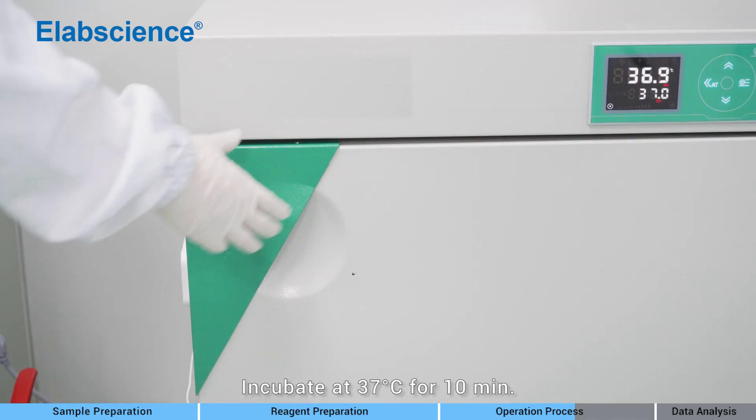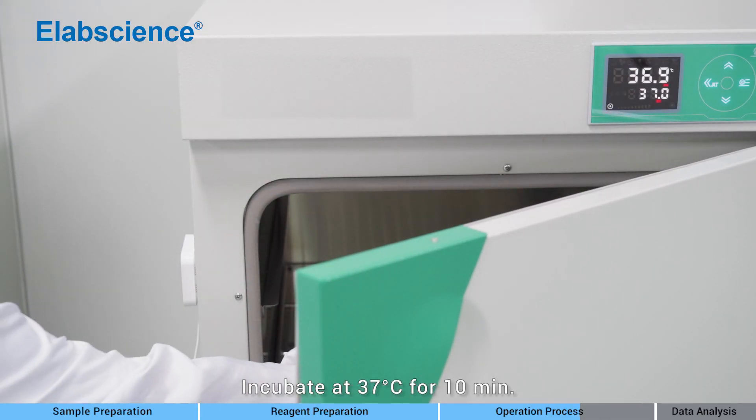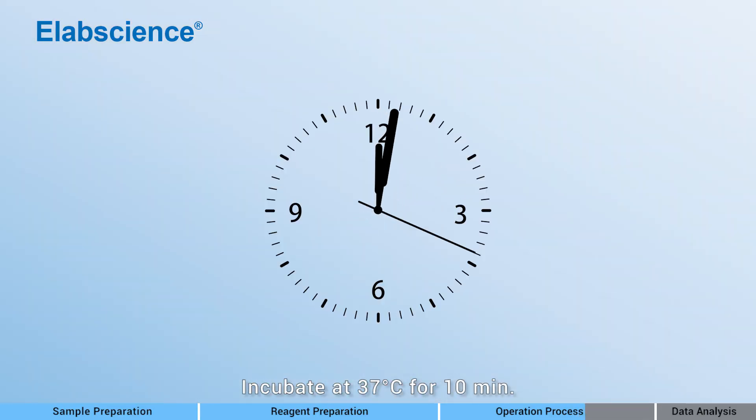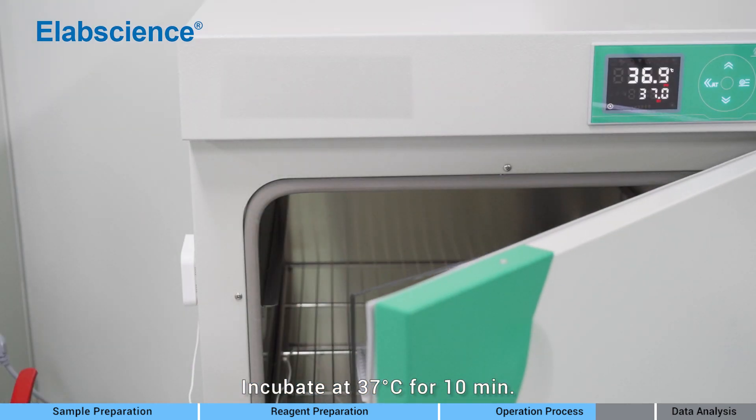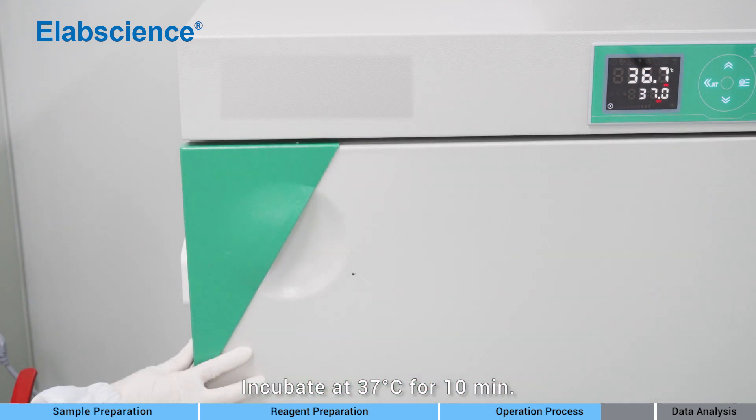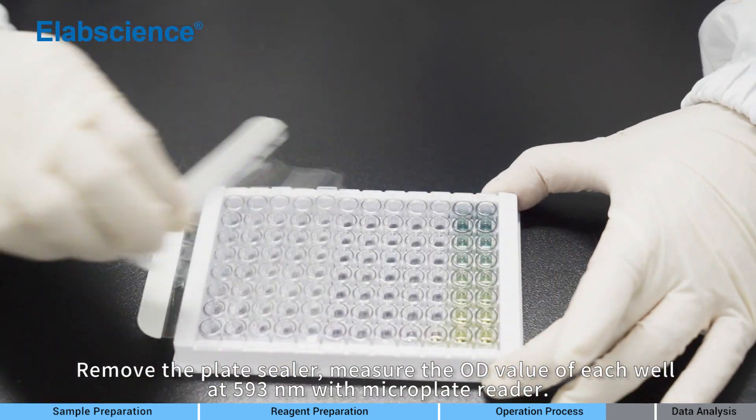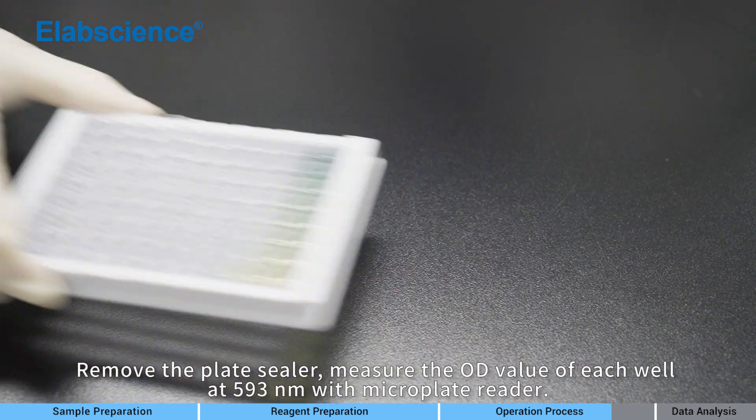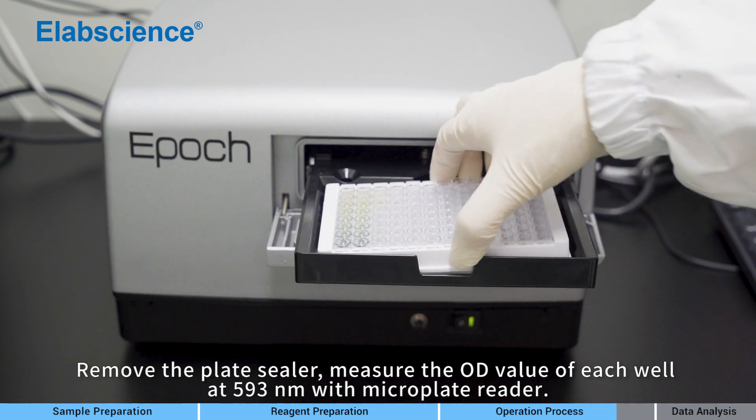Incubate at 37 degrees for 10 minutes. Remove the plate sealer. Measure the OD value of each well at 593 nanometer with microplate reader.